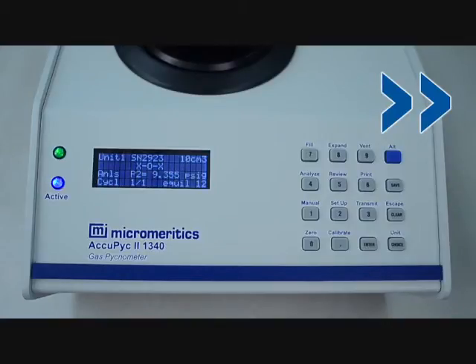When it is finished, the LED window will say terminate and the unit will beep 3 times, and it displays the volume, 51.0106. Returning back to reload mode.